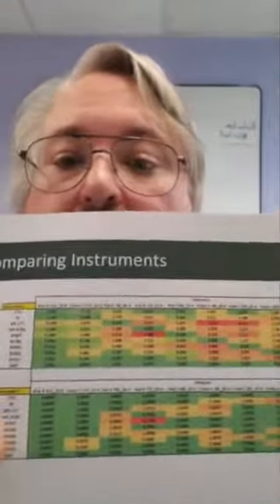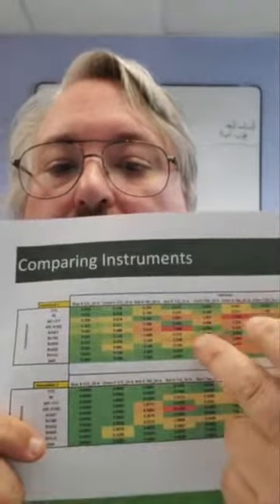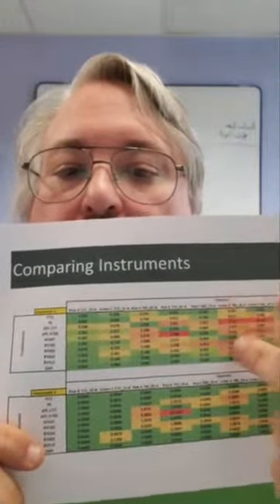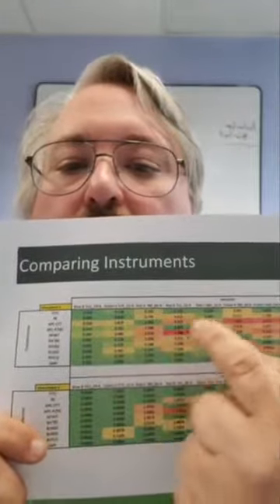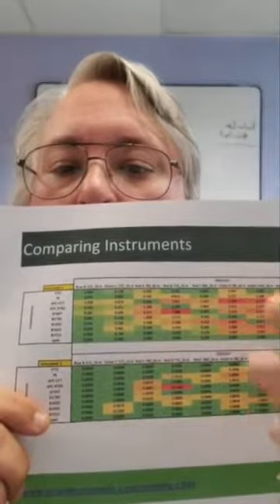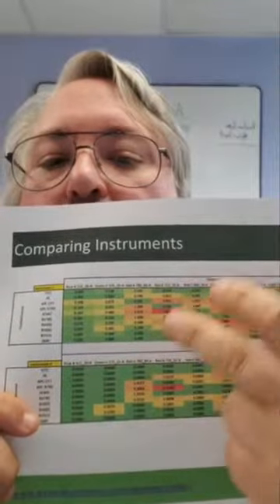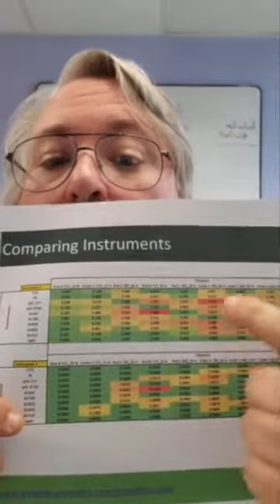What I'm showing on this figure are two different instruments, and we've calculated the SSM for these two instruments. We have the fluorochromes going across on the y-axis, and coming down in the columns are the detectors. So we can see where fluorochromes may cause problems. They're highlighted in red and yellow. Now if we look at these two machines, which have similar layouts, you can start to see that there are some differences between these instruments that may impact where we might want to design a panel or might want to look.